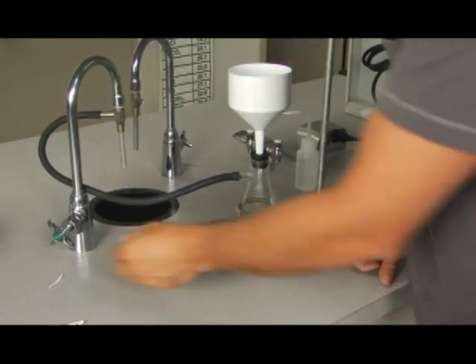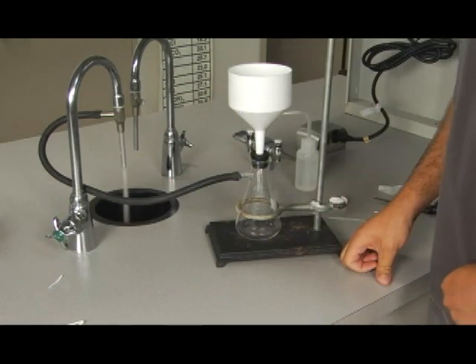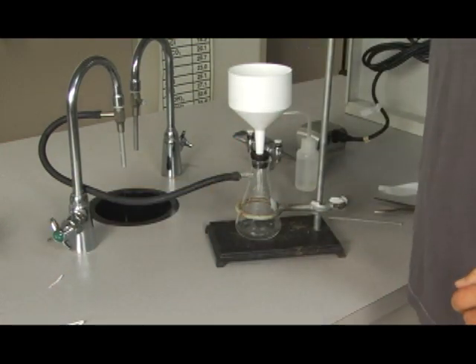And then to force fluid through, we simply turn the sink on. And you can see water dripping through here. Let me turn this off and we'll try with a colored solution.